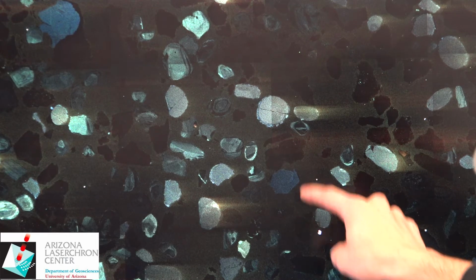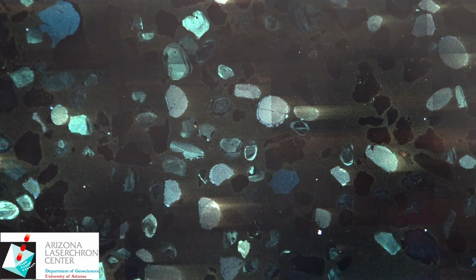Most minerals do not fluoresce inside of CL, which is indicative of all of these really dark crystals. That just indicates no response, most likely not a zircon. The only way a zircon can be pitch black like that is if it has a uranium concentration that is very abnormal and that uranium is distributed evenly throughout the crystal.